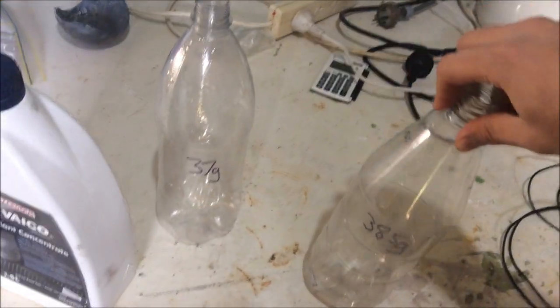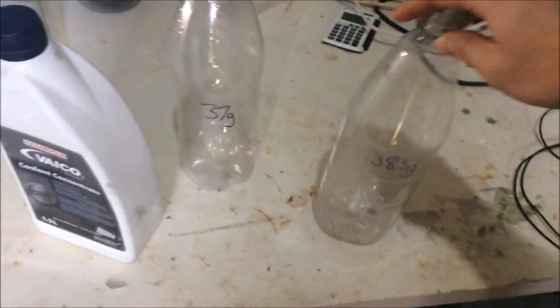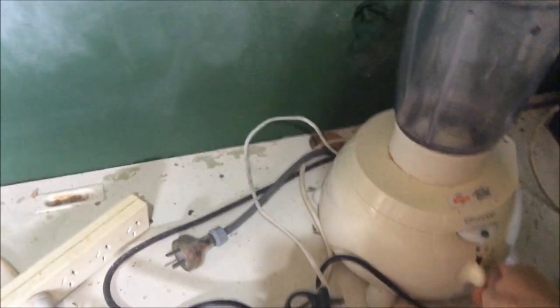So we've got these two bottles here, hopefully we'll be trying to use all of these up. So we're going to cut these into pieces and then chuck it in the blender.